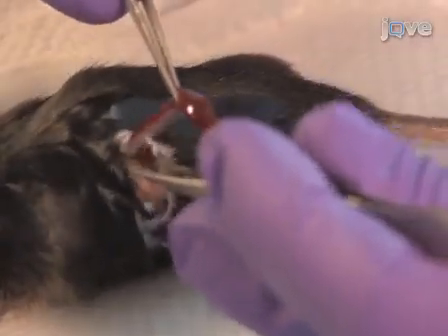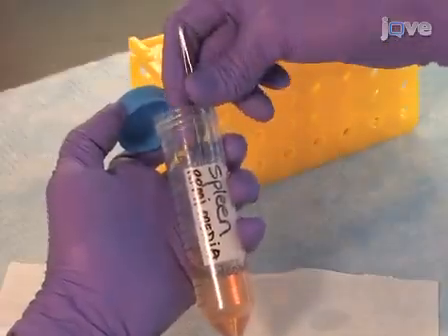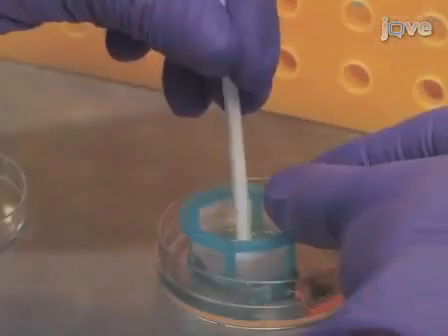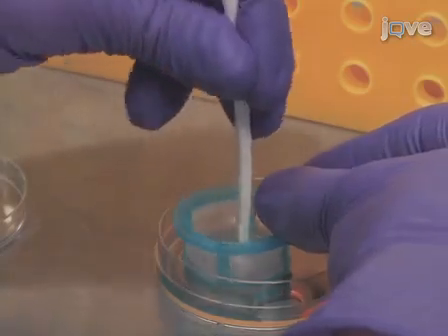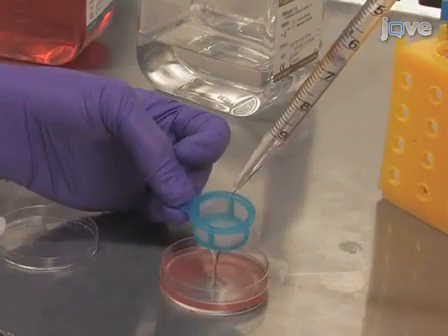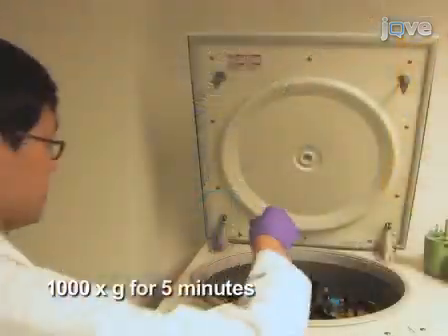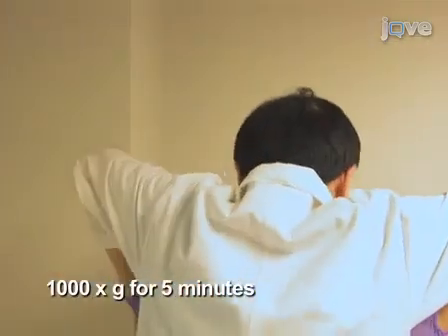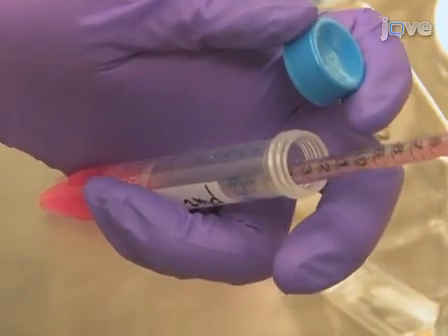Harvest a mouse spleen and transfer to RPMI medium. Place the spleen in a cell strainer. Mash the spleen with a syringe plunger into a 5 cm tissue culture plate. Rinse cells off the cell strainer with sterile PBS. In order to harvest the cells, centrifuge at 1000 times G for 5 minutes. Discard the supernatant.